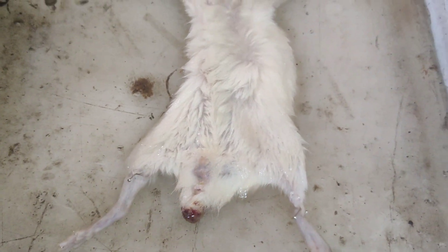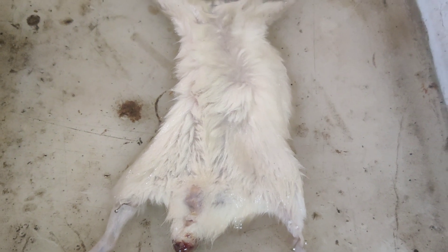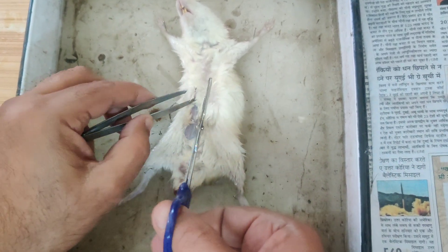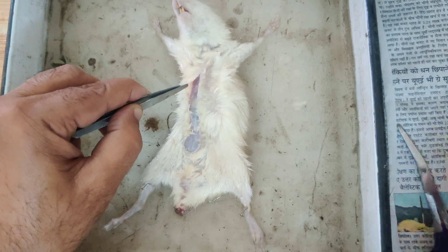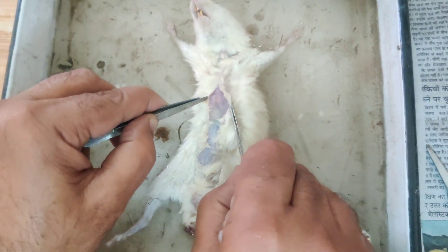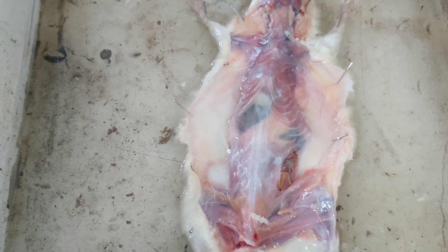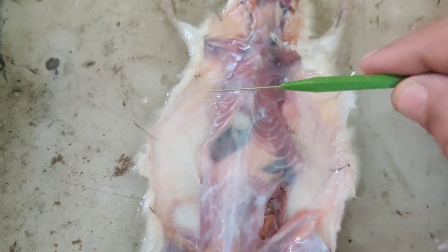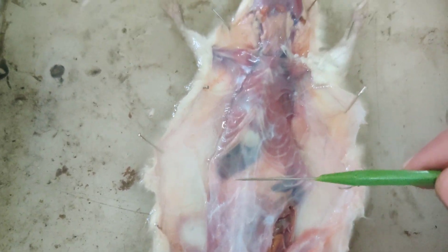The forelimbs and hindlimbs are pinned. First I will remove the skin of this animal. After removal of the skin, the body wall will be visible, and we have to remove that body wall also. So I am removing the skin, and below the skin you can see the body wall. The skin is removed but still the body wall is there.